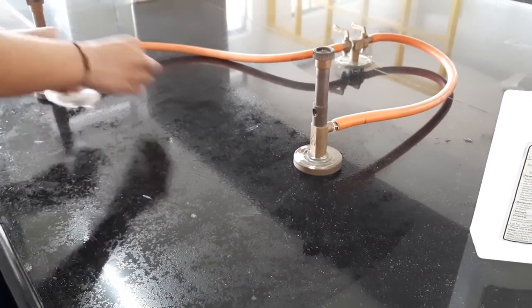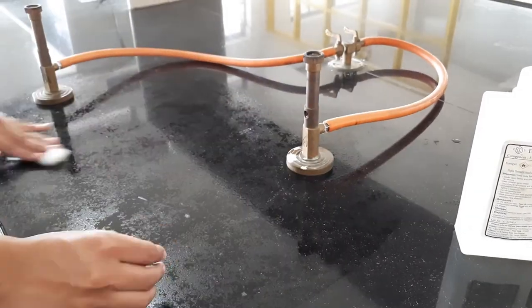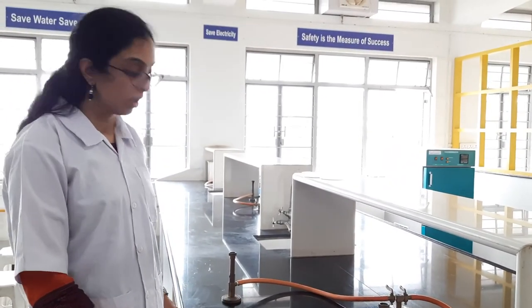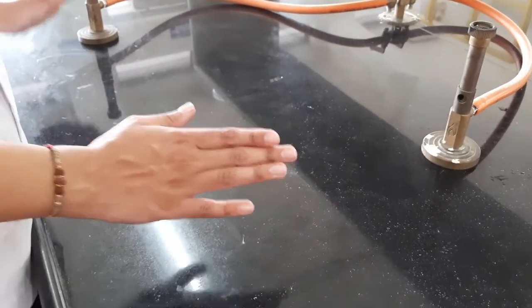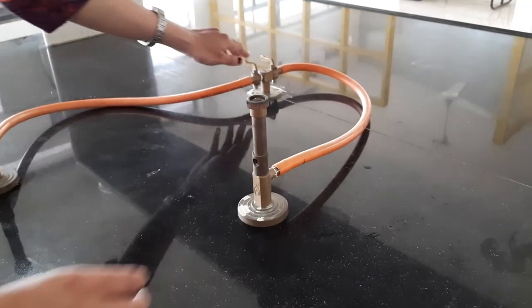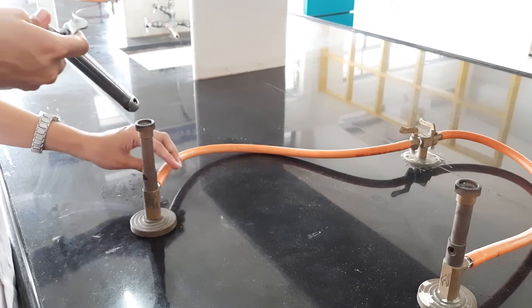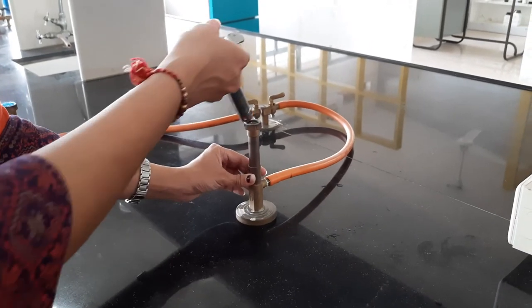Clean the platform properly and allow the alcohol to evaporate. Now the alcohol has vaporized and this section is completely sterilized. We will now need to maintain a sterilized air environment, so I will switch on the burners.